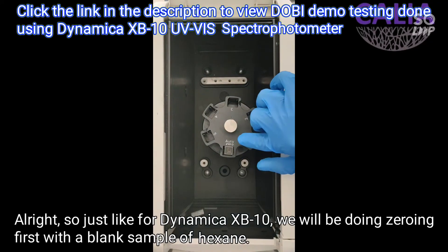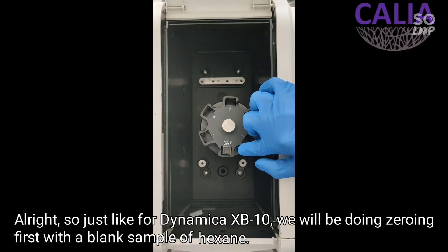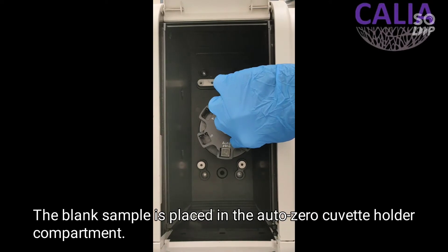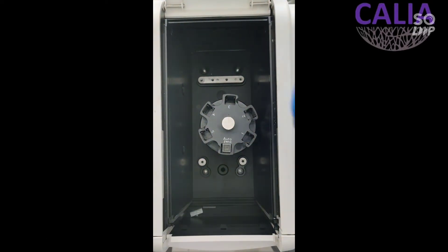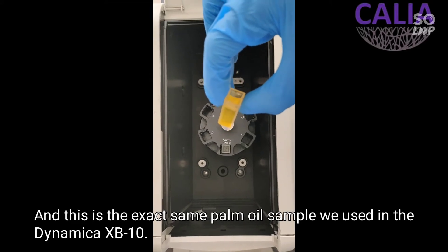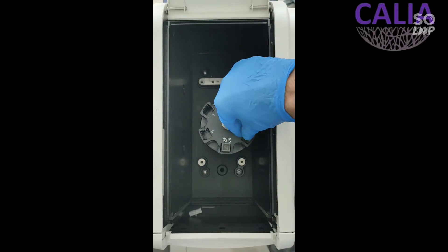Just like for the Dynamica XB10, we will be doing zeroing first with a blank sample of hexane. The blank sample is placed in the auto zero cuvette holder compartment. This is the exact same palm oil sample we used in the Dynamica XB10, and we place this in cuvette compartment number one.